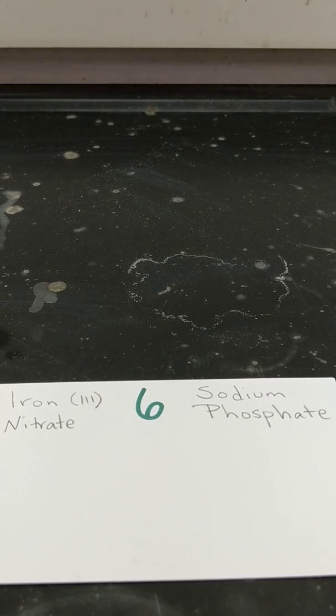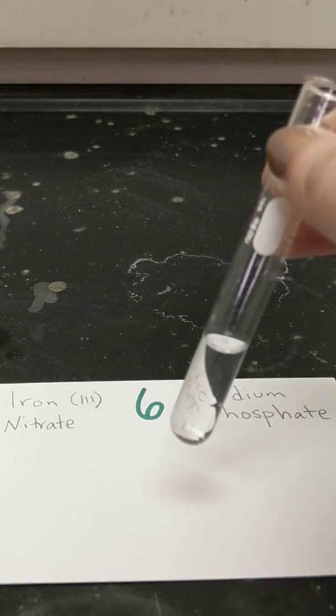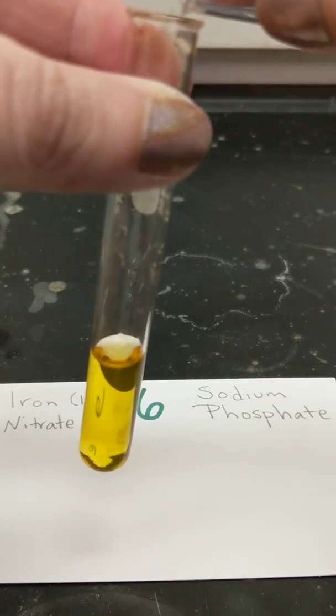Reaction 6, iron nitrate and sodium phosphate.